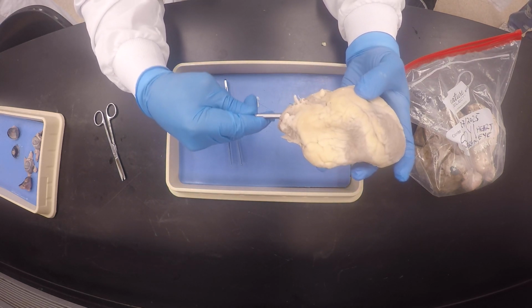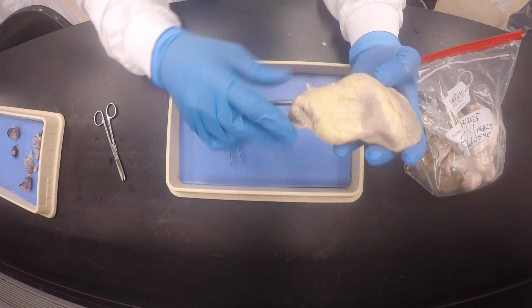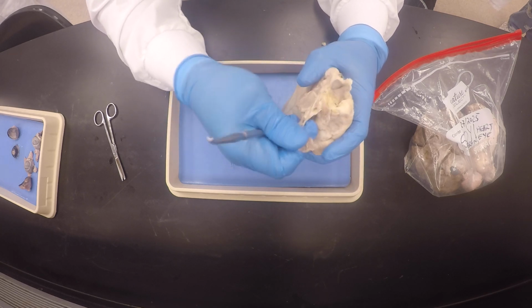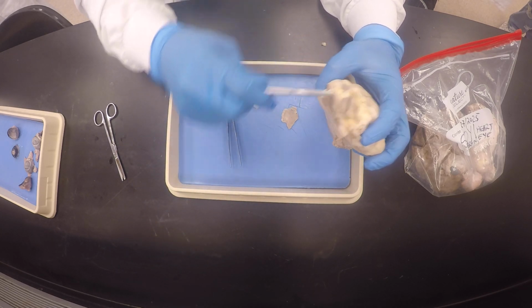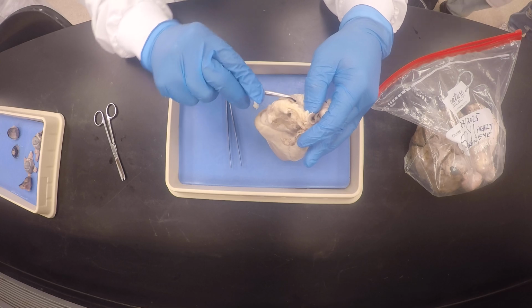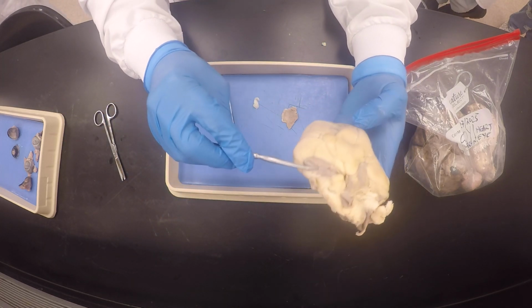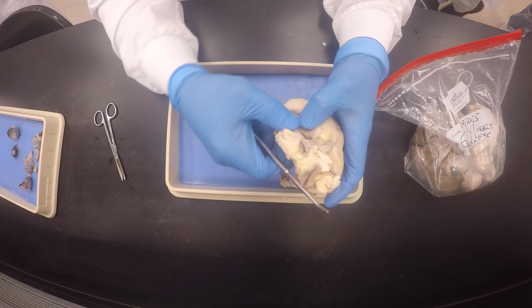It's so thick, but this one is going here. And I don't want to do like I did here. You know what I'm saying? Okay, so there's that. And we do have some of these blood vessels here. So this is the pulmonary trunk for sure. And obviously this is the left auricle. It's kind of folded up a little bit, you know, left auricle.